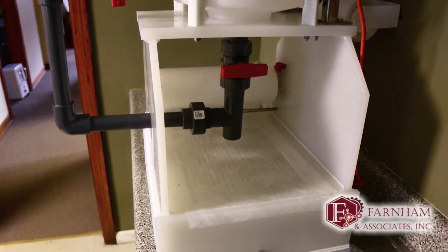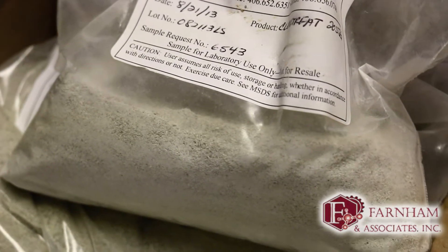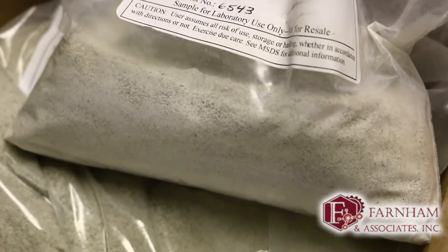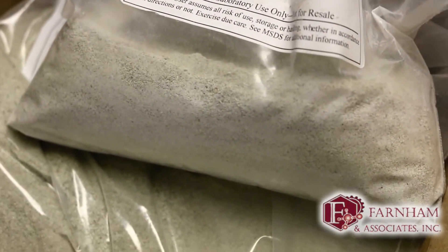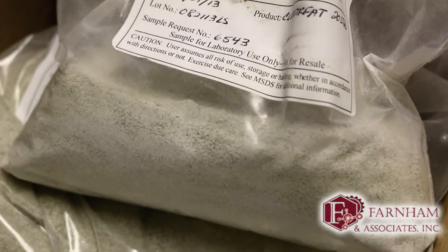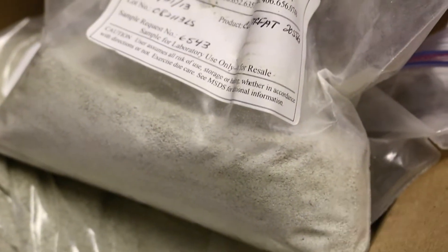This is our sample of Wild Bend — this is a bentonite clay mixture. I'm not exactly sure what the mixture is, but I think it's anywhere from 80 to 90 percent bentonite clay mixed with soda ash, maybe. It's a pretty simple compound and it worked pretty well yesterday on the sample we had, so we'll see if it works on the fresh sample I collected today.